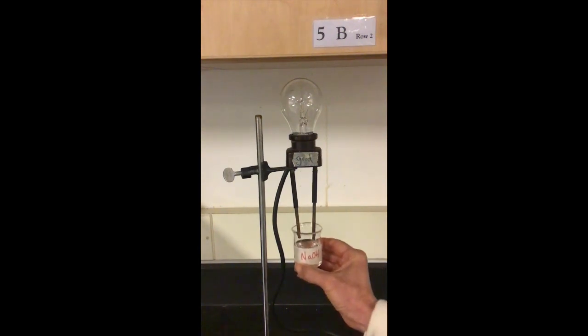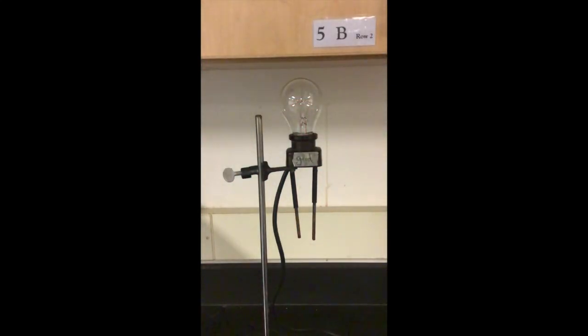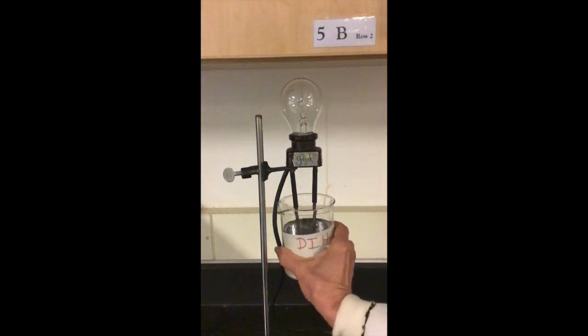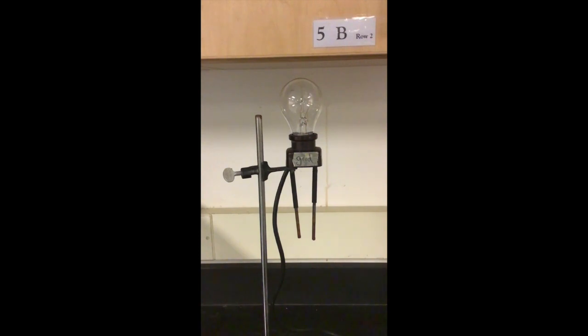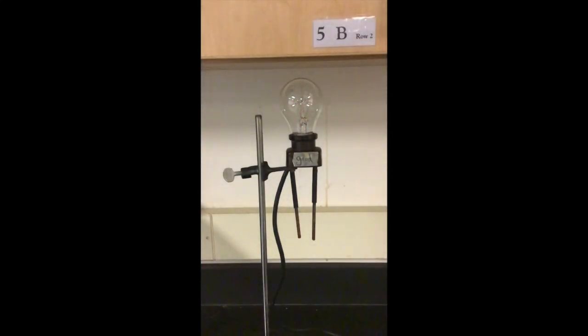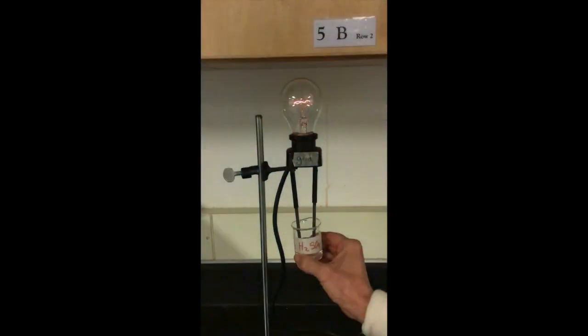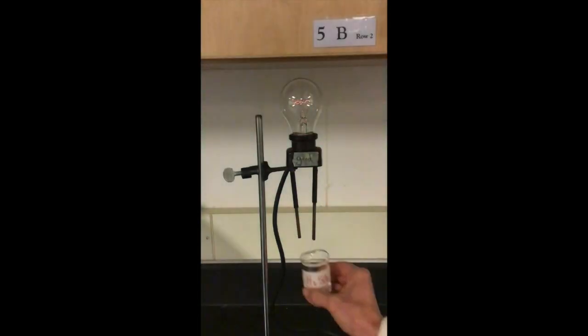The next solution is sodium hydroxide. I have multiple containers of DI water to make sure our probes are clean. Next, we have hydrochloric acid. One thing that's important when you're doing this experiment is to be careful not to ever touch those probes, because you can get a very nasty shock. This was H2SO4, sulfuric acid.